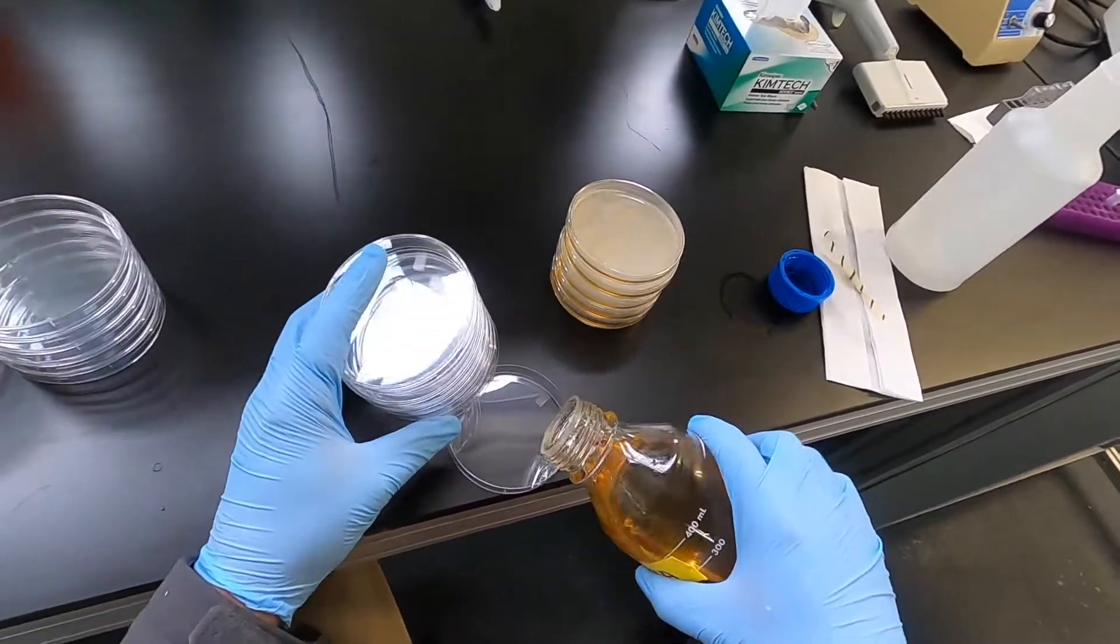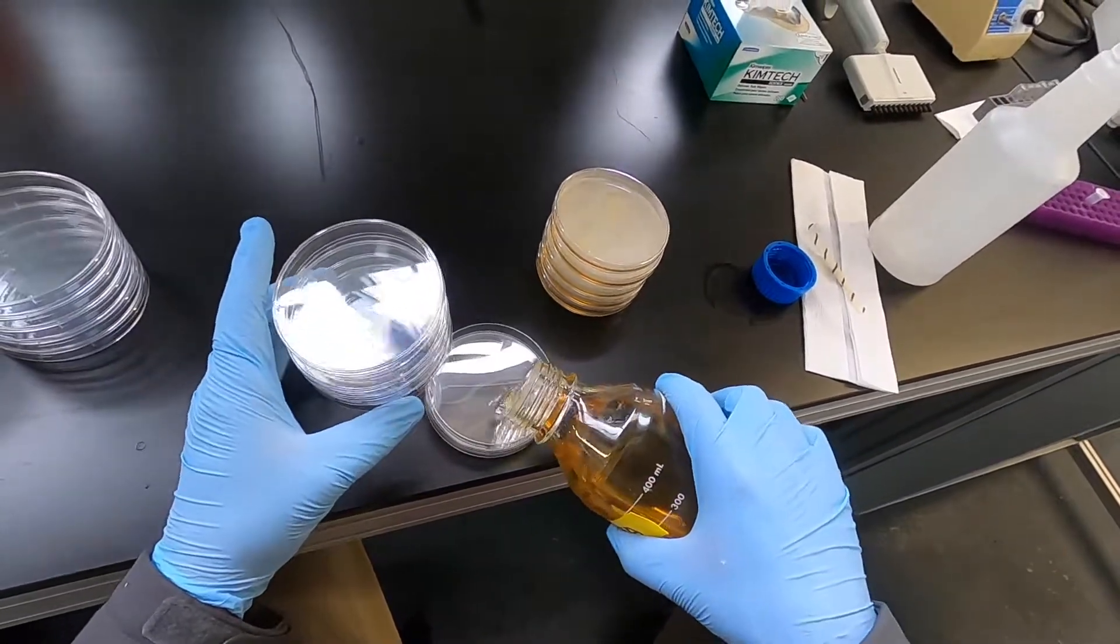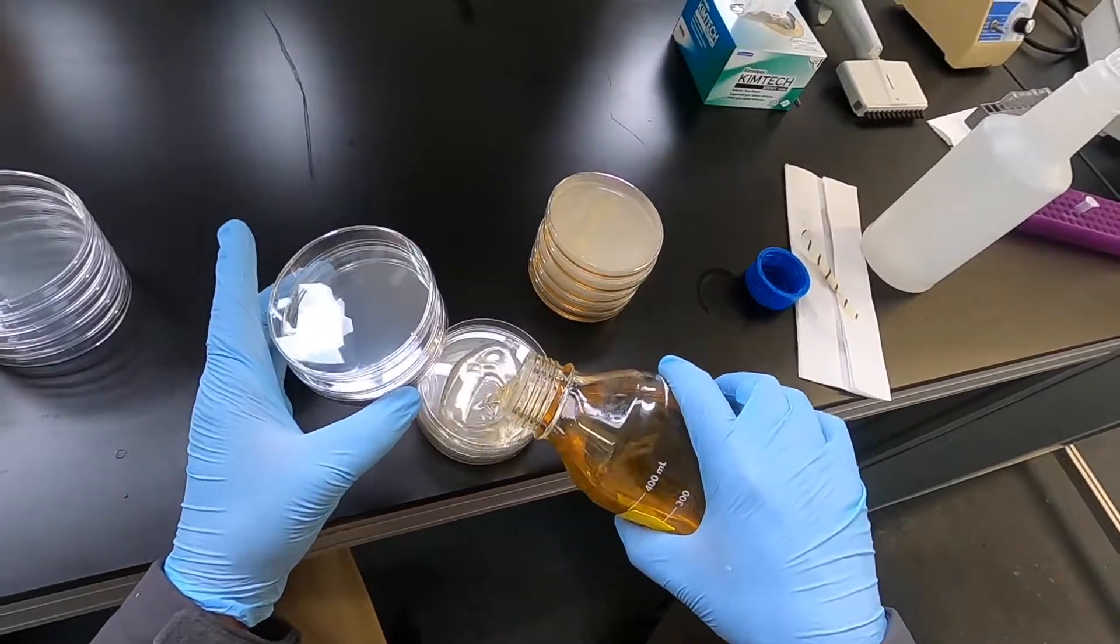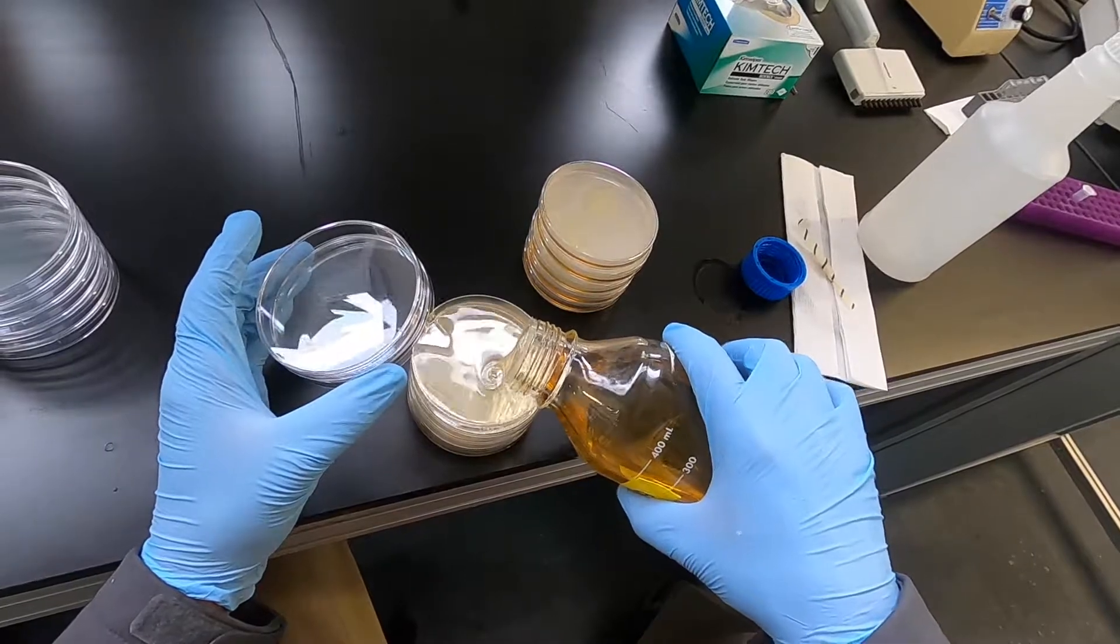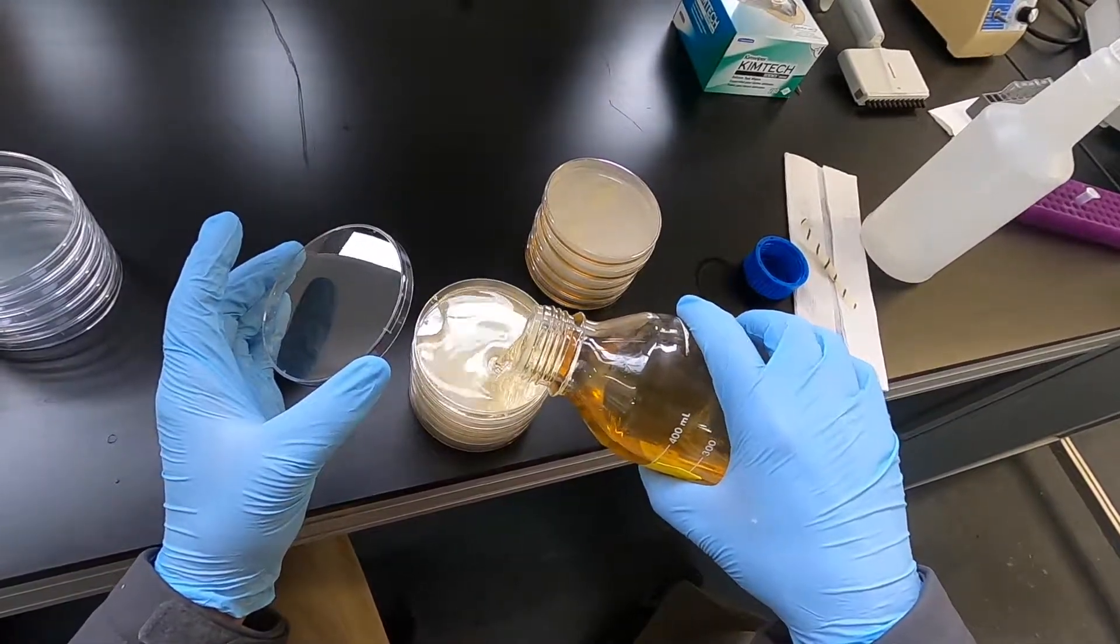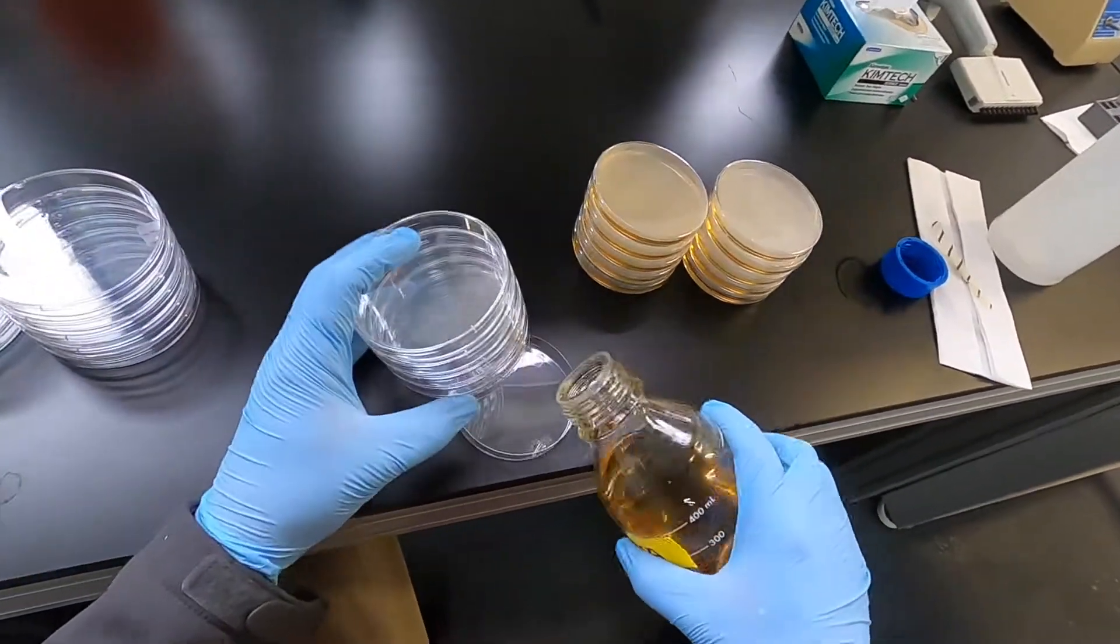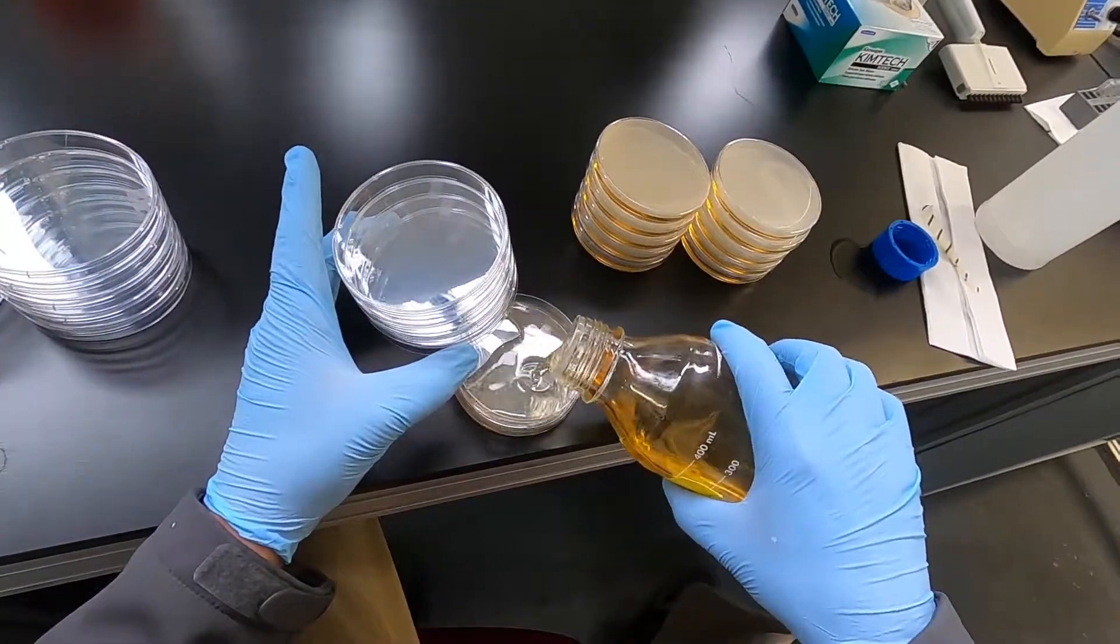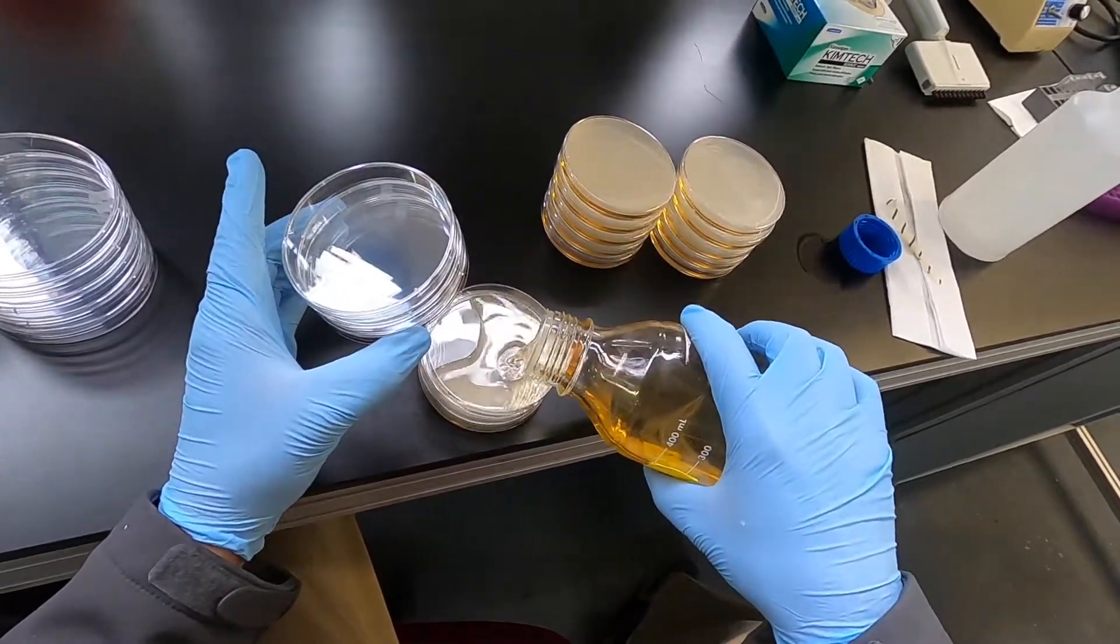Next. Generally try to pour until you cover the bottom of the plate, but sometimes you'll end up a little short. You can kind of guesstimate how much you have left. And with practice you'll end up being able to generally perfectly pour a stack.